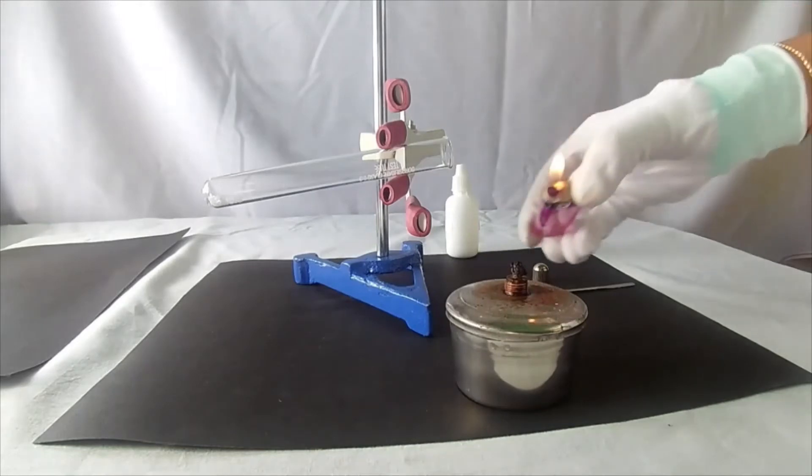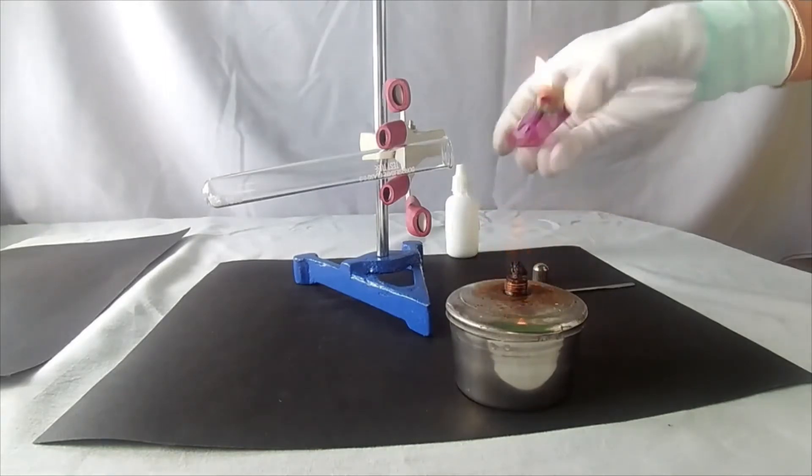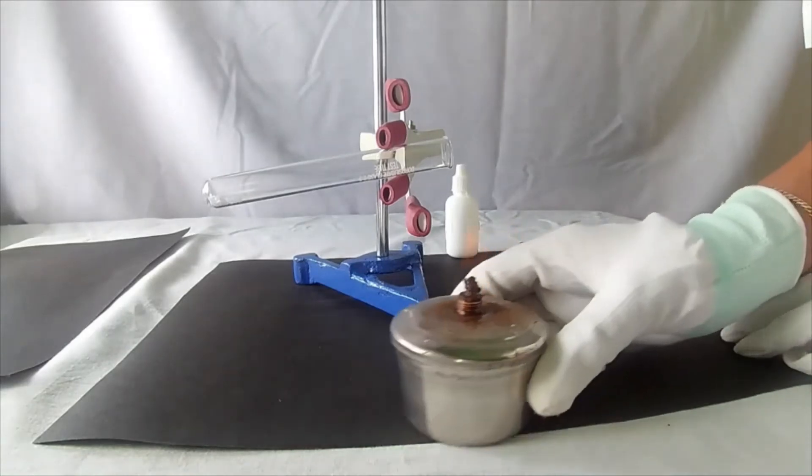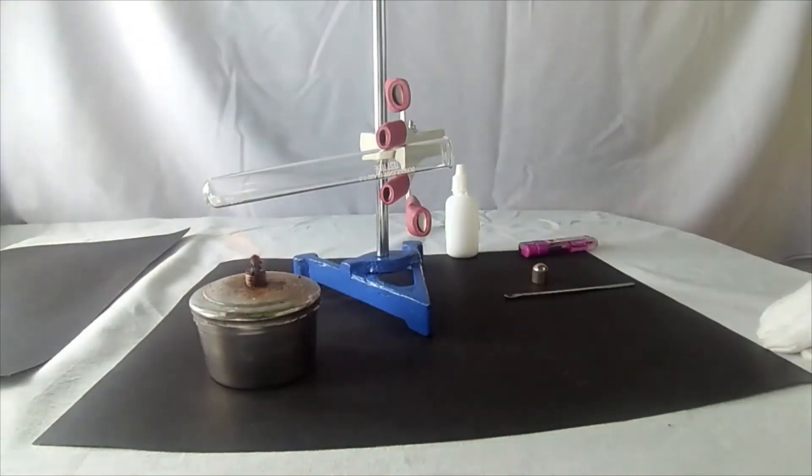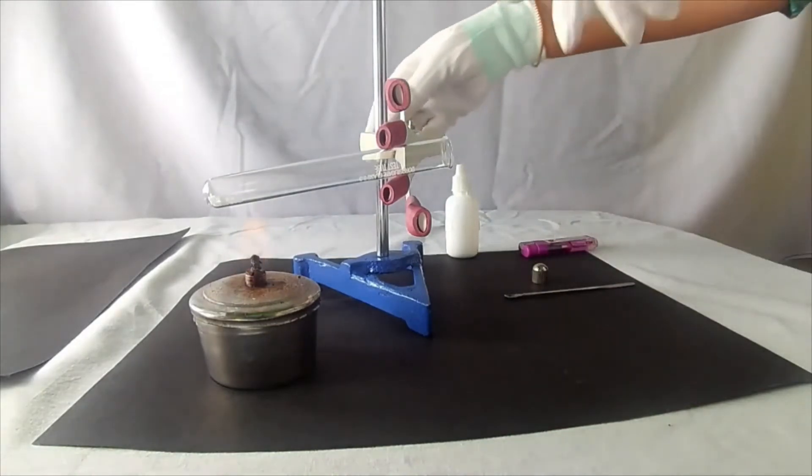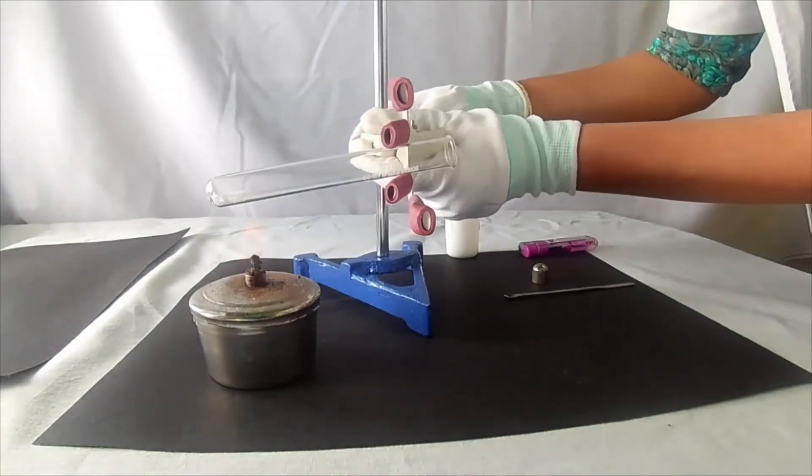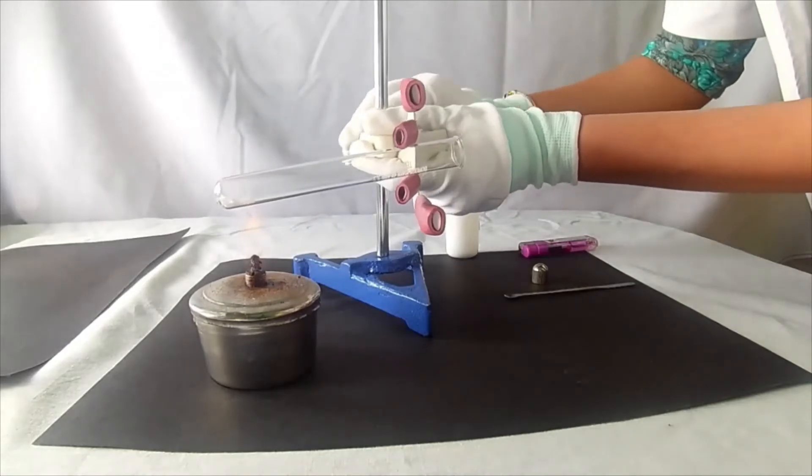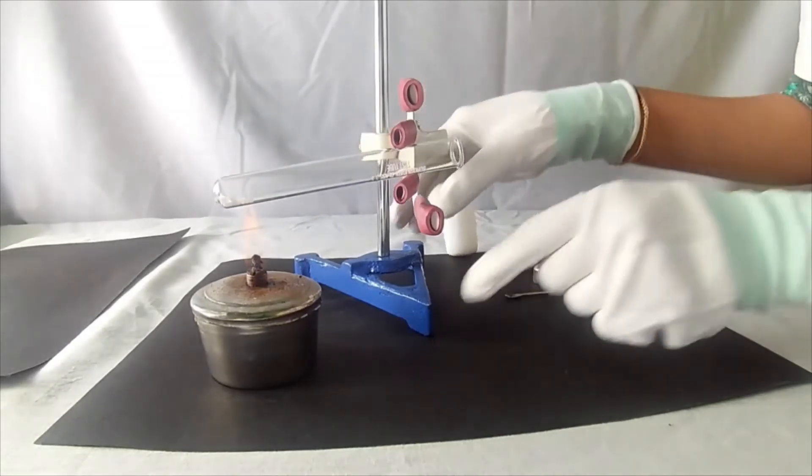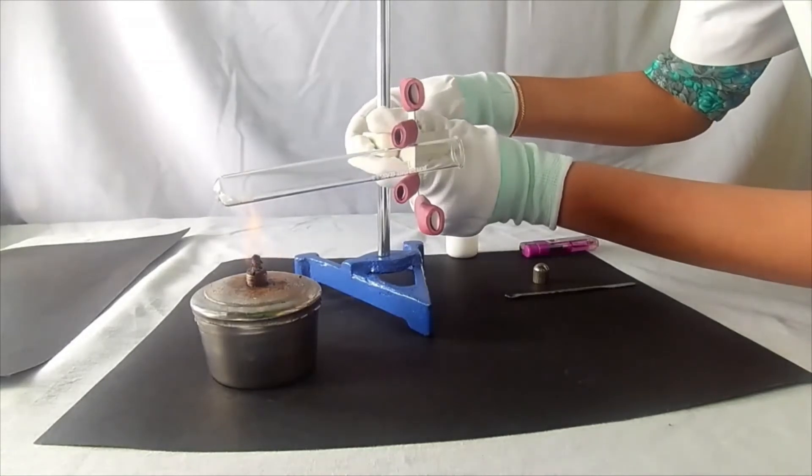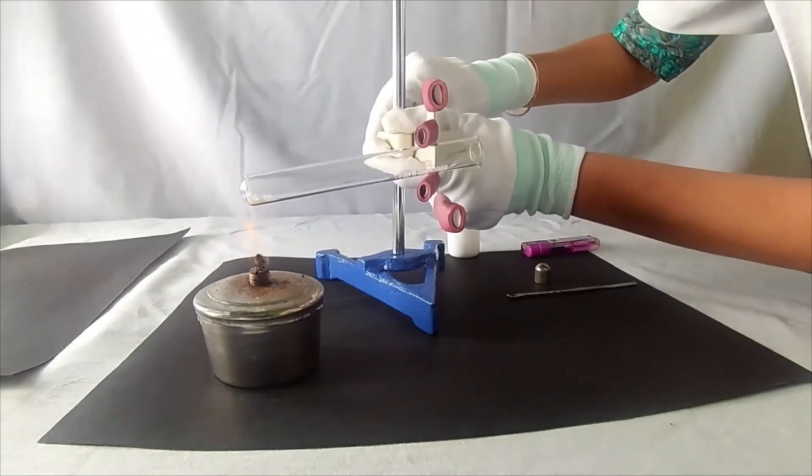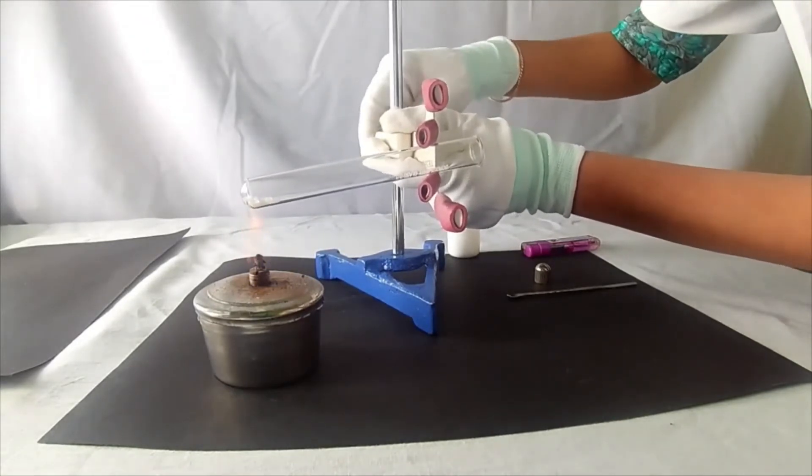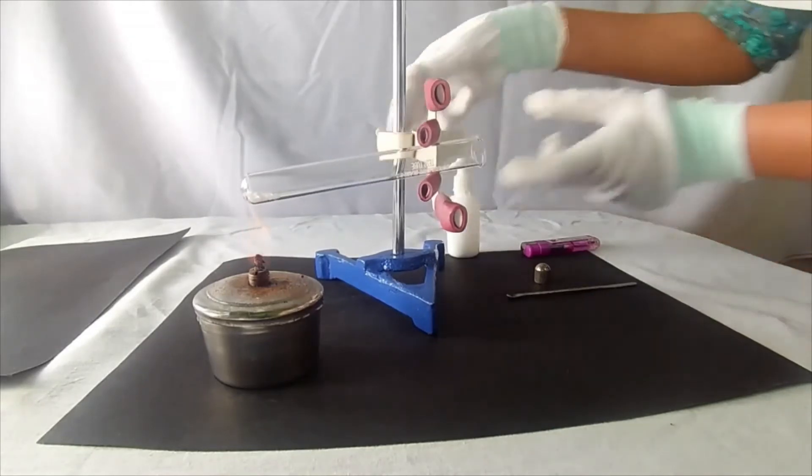Light the spirit lamp using the lighter. Keep it below the test tube. Adjust the stand so that it can be heated properly. Be careful while performing these experiments.